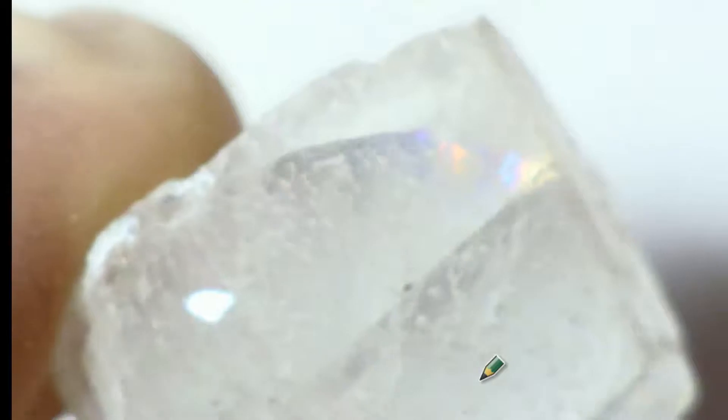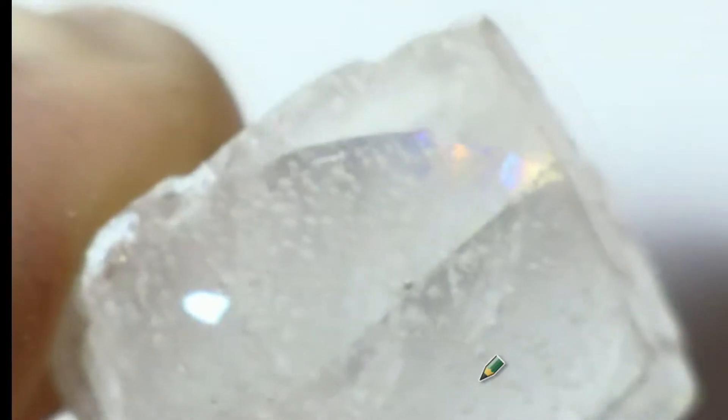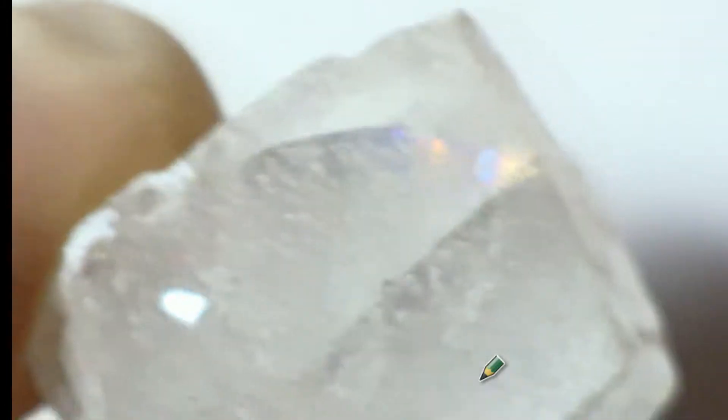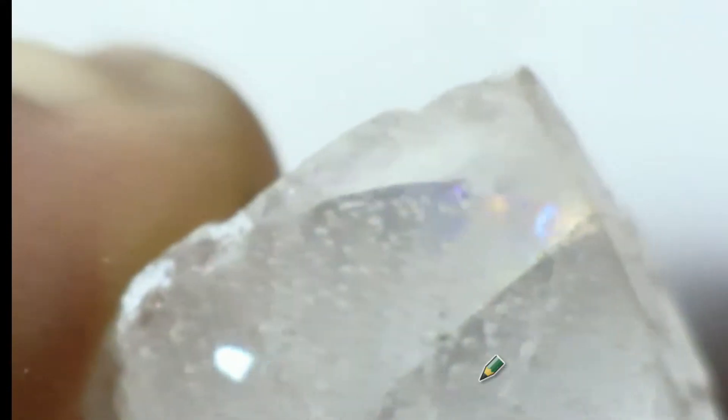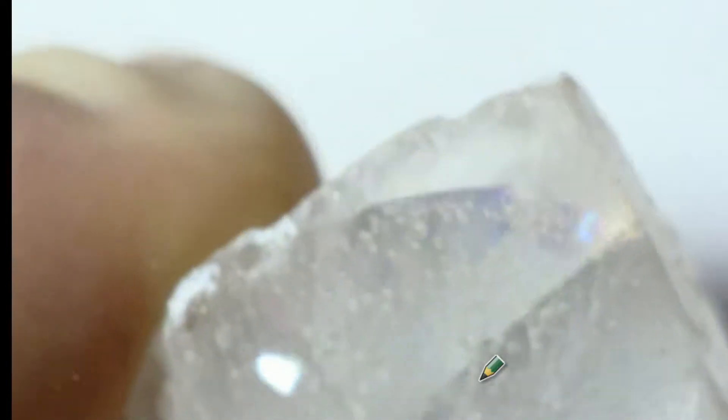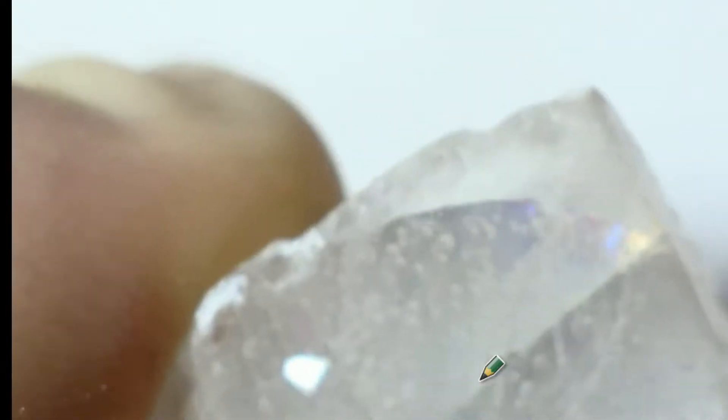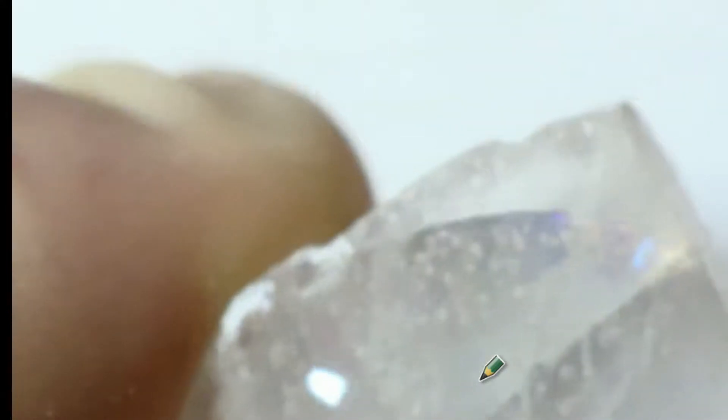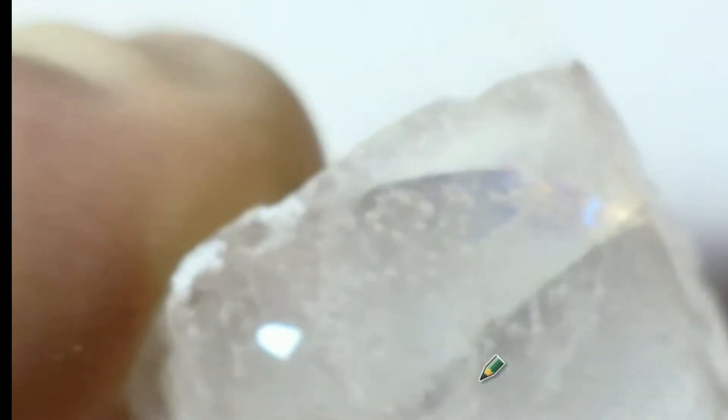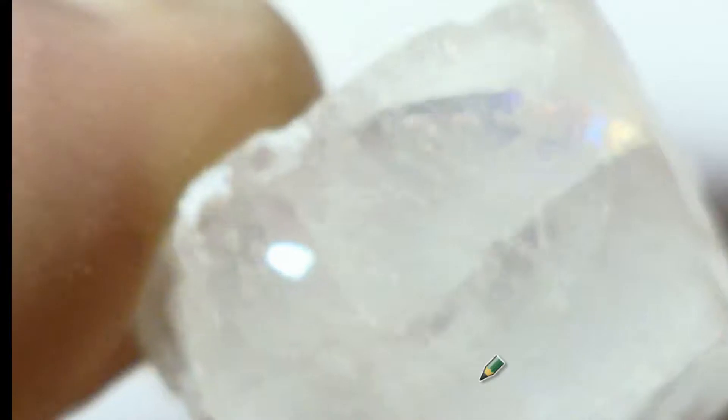Oh, that's too bright. Should dim it. Ah, there we go. You can see some bubbles moving. You see that? That's amazing. This here, this calcite, does have carbonate. In fact, calcite and limestone are very similar in terms of the amount of carbonates that they have. It's not fizzing as much as the limestone, but it's still making some fizz pop. In fact, there's a lot of bubbles. And let's test this last one here.